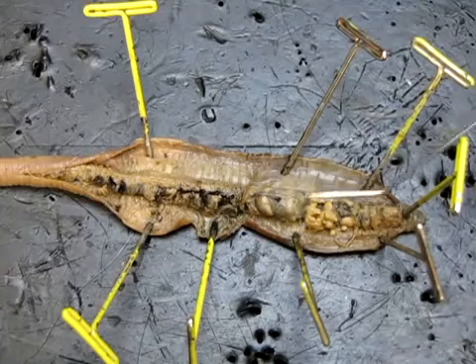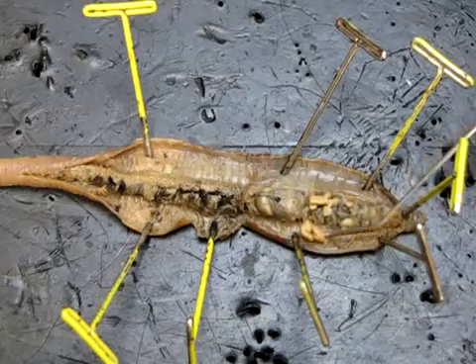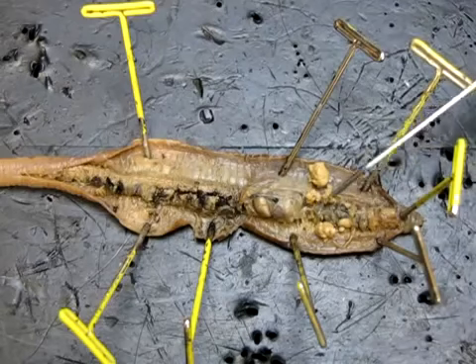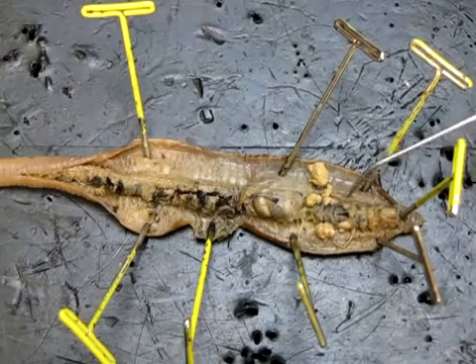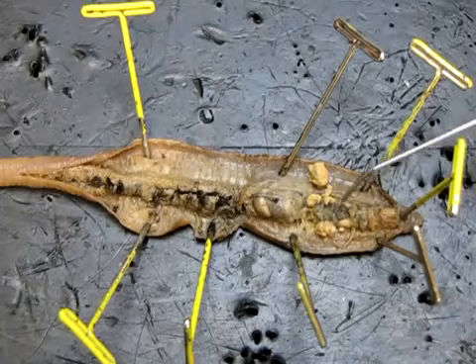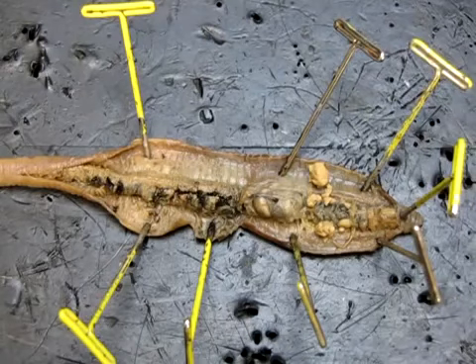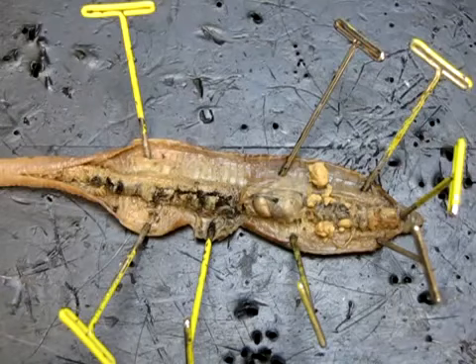Now, the other thing going on in this region of the esophagus, I'm just going to move some of these reproductive structures out of the way so we can see a little bit better. You'll notice that there's this darker mass on top, sort of right here. And it actually consists of a series of rings. If I move them apart, you should be able to see, here's a ring right here. There's another ring right here, another one here, another one here. Pretty much in each segment there you'll find a little dark ring. Those are called aortic arches, and those basically make up what we would consider the heart of this animal.